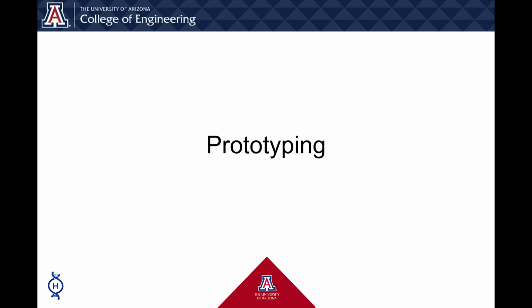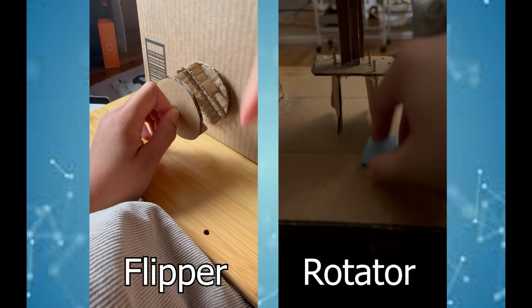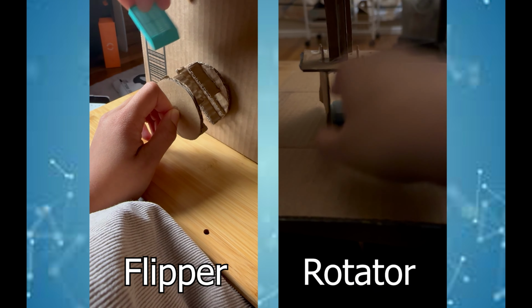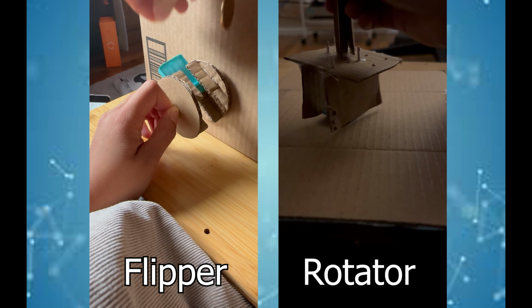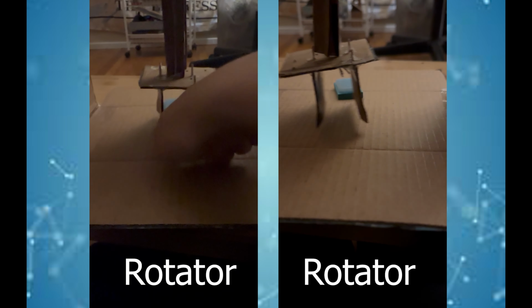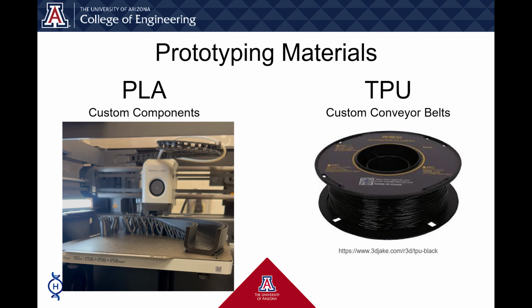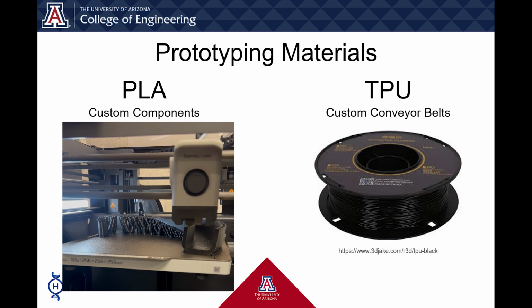The process of prototyping involves first making cardboard parts of the rotator and flipper. The flipper started off as 2 discs with 2 bumpers that stops tissue blocks that are upside down. Inspiration for the rotator comes from a toy claw machine with the intent of pushing the blocks 180 degrees. We decided our materials for 3D printing are PLA for our customized parts and TPU for our conveyor belts due to its stretchability and easy customization.